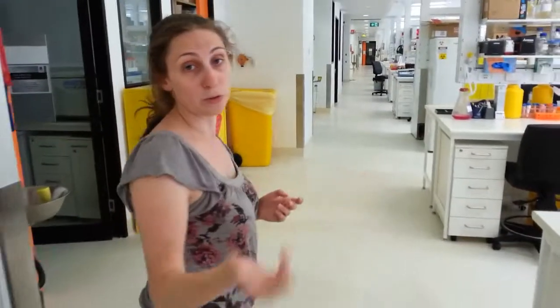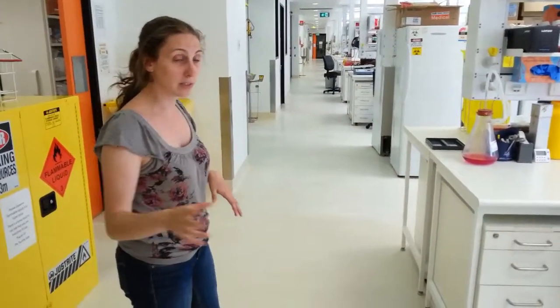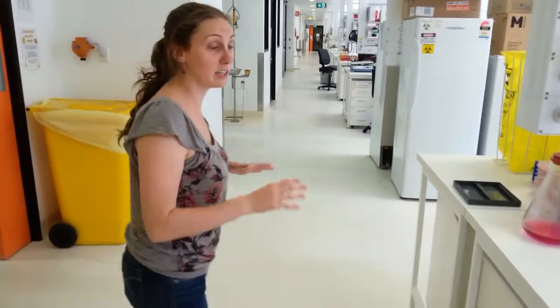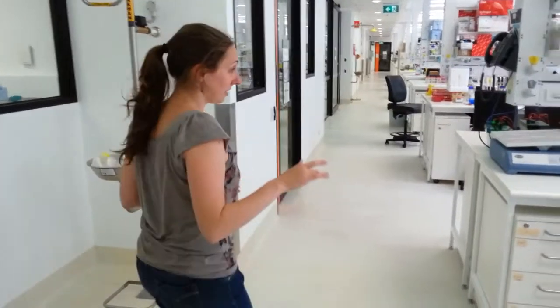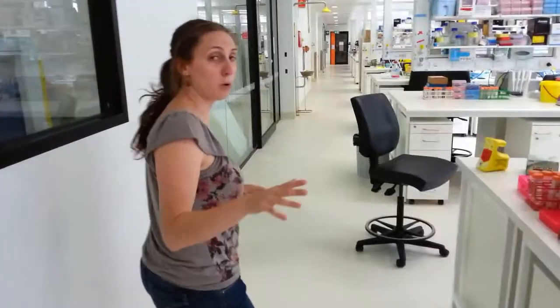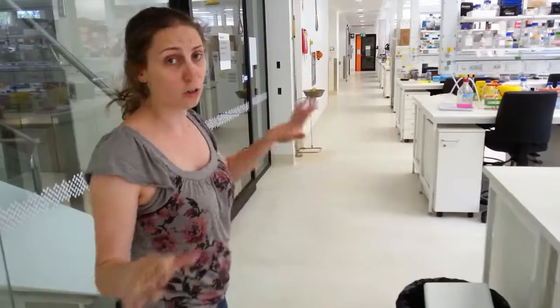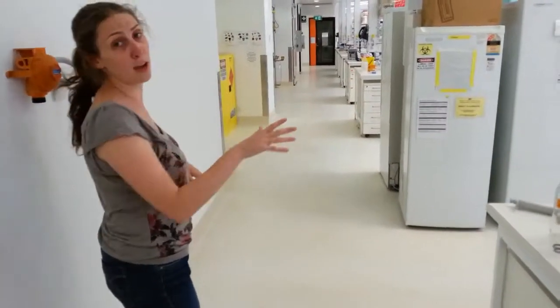So the lowest risk group is risk group 1, and that's some sort of organism that's probably not going to give anyone a disease at all. Step up from that is risk group 2. This is something that might give you a disease, but it's something we can treat pretty easily. It's not going to spread, so it's not really much to worry about. Risk group 3 is like, that's a disease you're probably not okay with, but we can treat it and it's probably not going to spread fast, so you'll manage. Risk group 4 are the kind of things they like making movies about. I mean, get that stuff on yourself and you're gone along with everyone you know. It's the stuff where they say things like, we can't treat that, please be more careful with those vials.